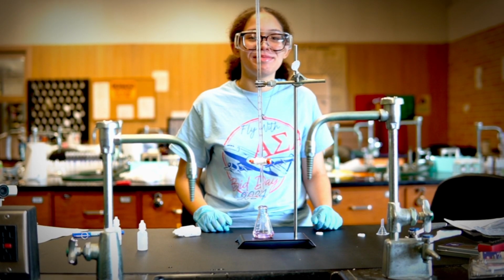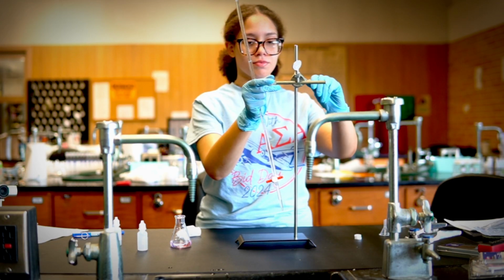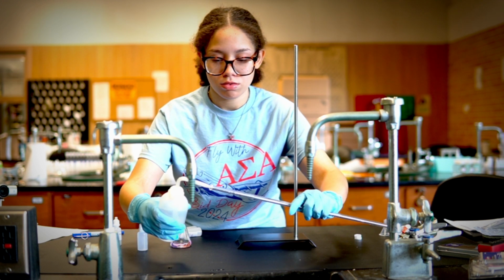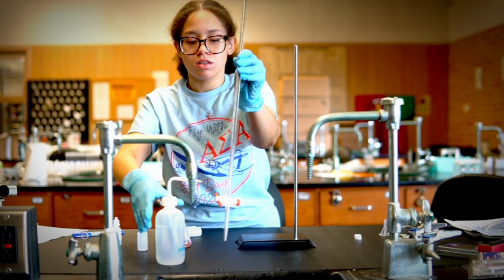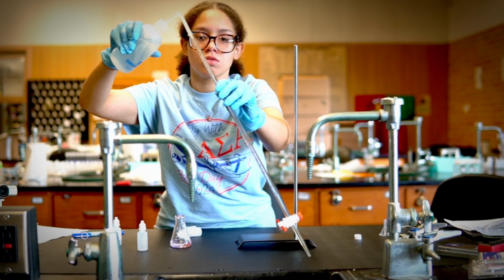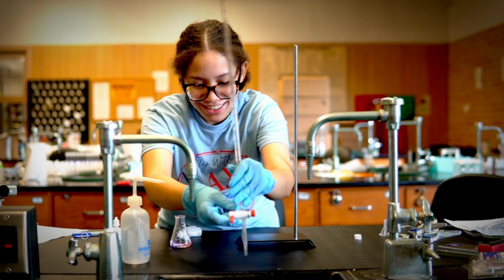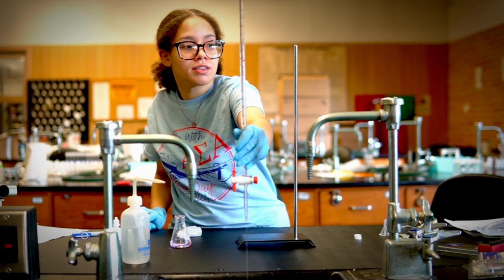You have hopefully had a successful first titration and you're ready to clean up. So make sure that you disassemble your stand, clean your burette really well, clean everything else, and you are good to go. Make sure that you dispose of all the chemicals. You can pour them down the sink as long as you add a lot of water, and then keep the chemicals that you haven't used. And after that, you should be done.